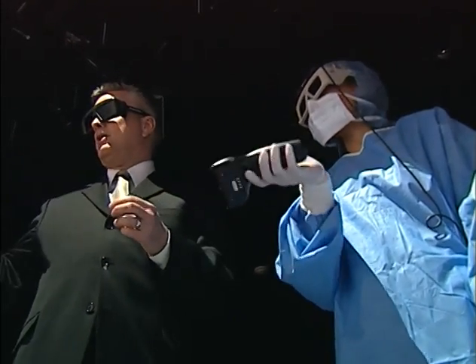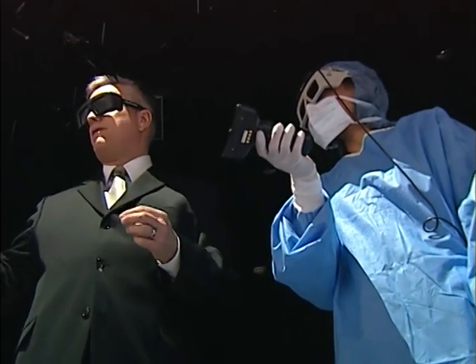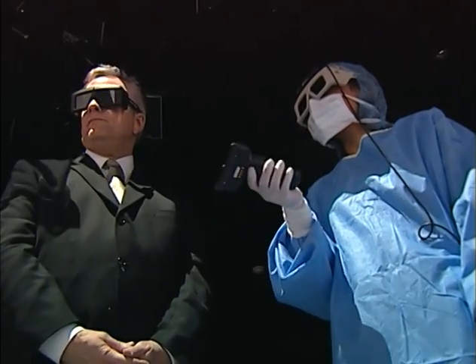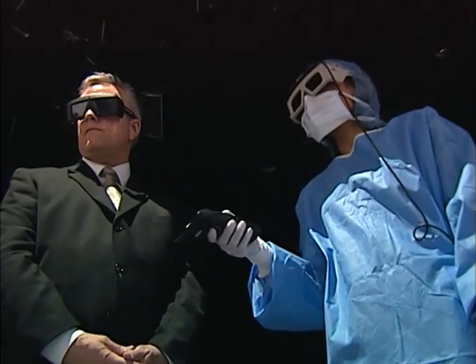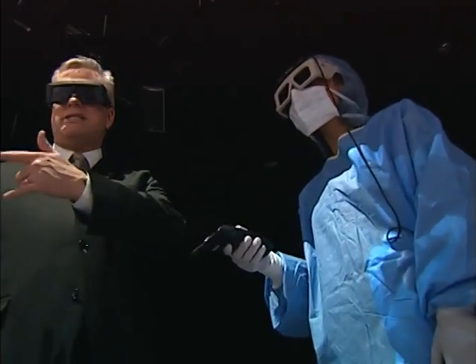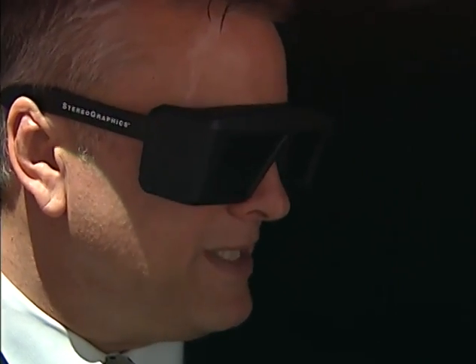Maybe you can take a look either at this middle hood or the far hood and see if you think there's anything in there. How about here, right here? Is this appropriate? Do you know what those are? No, what are they? Those are actually dispensing windows. Be able to tell if somebody over here needs some help and they can pass back and forth and actually do the checking and just make the operational piece of things run a little bit more efficiently. Okay.